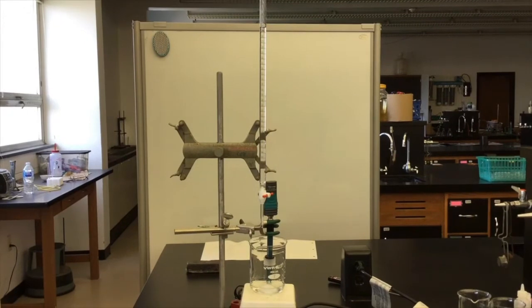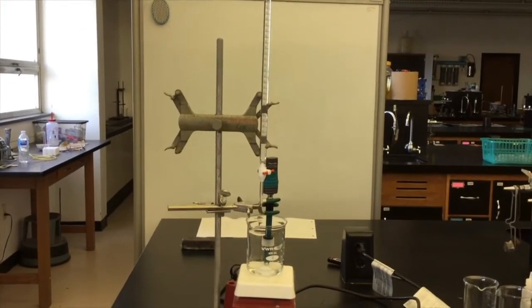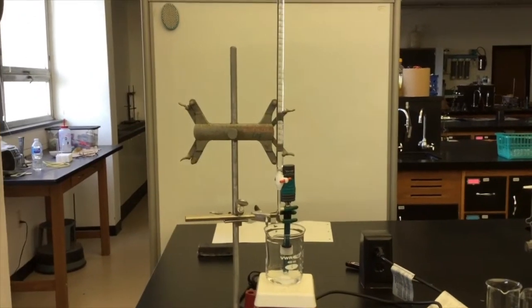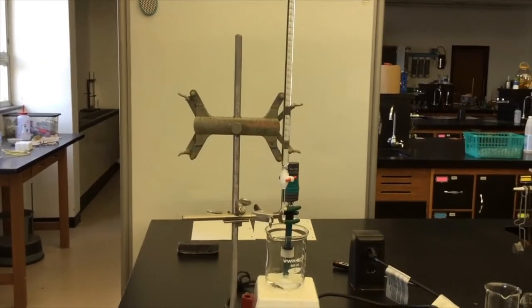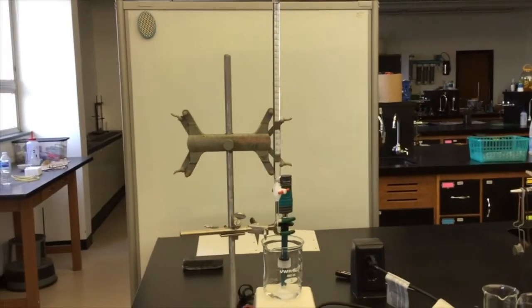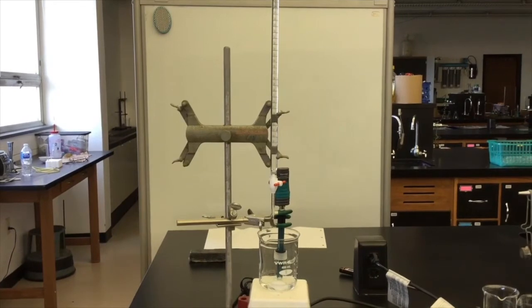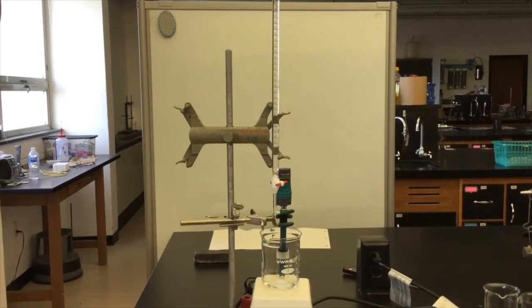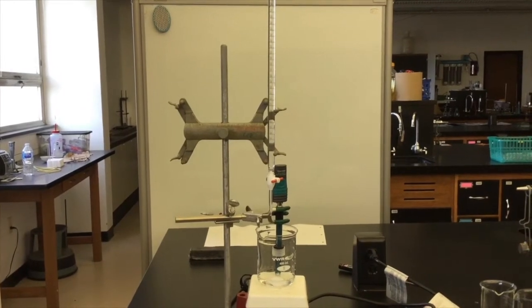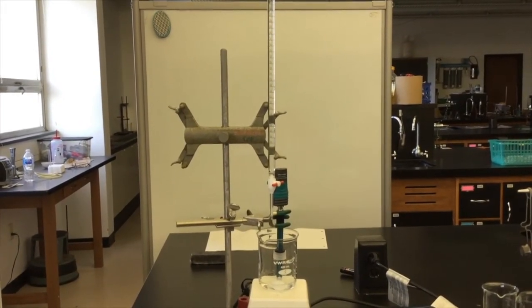In our last lab, we used the titration with a burette and phenolphthalein to determine the concentration of acetic acid in vinegar. Sometimes you will use an indicator such as phenolphthalein, but sometimes a titration curve is more useful. So what is the relationship between a titration curve and the endpoint we find with our phenolphthalein indicator?